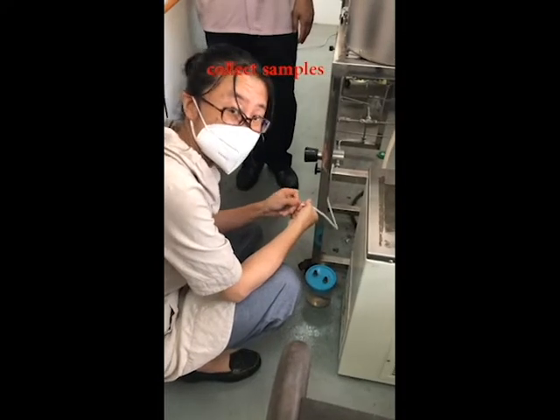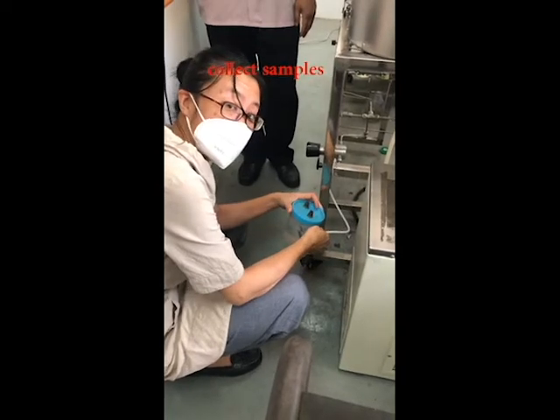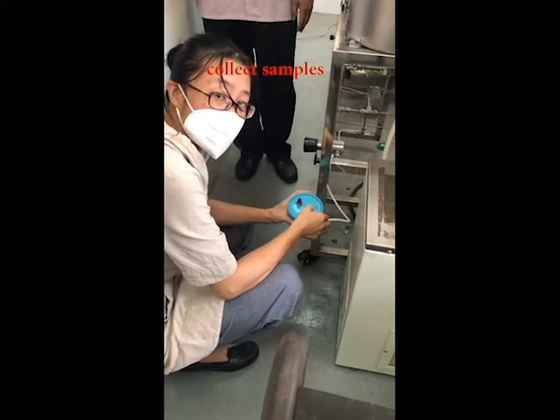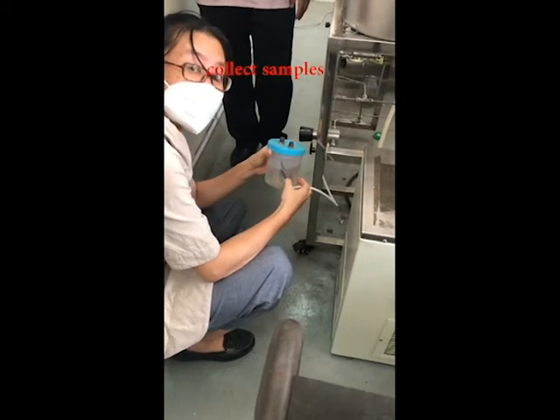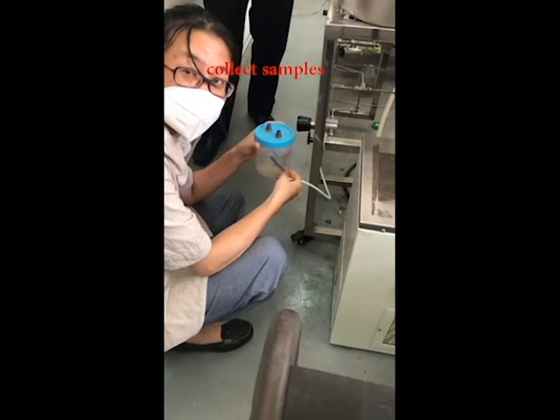You collect the sample from here, right? This one is a bubble indicator. Previously, I saw students connect the gas sample from here. If you want to connect the gas sample from here, you cannot fill in water here. You can fill in sulfuric acid.